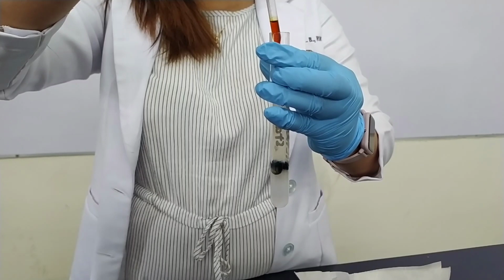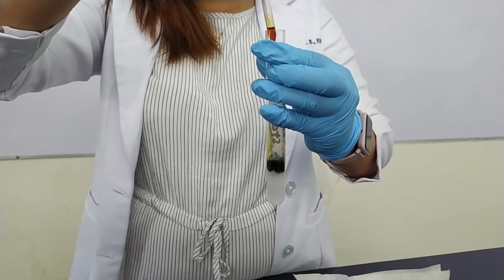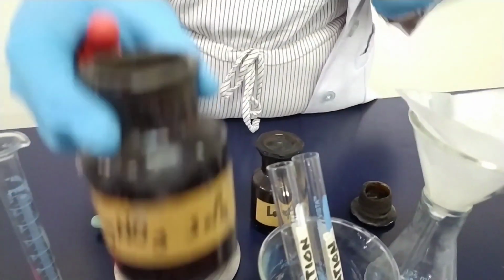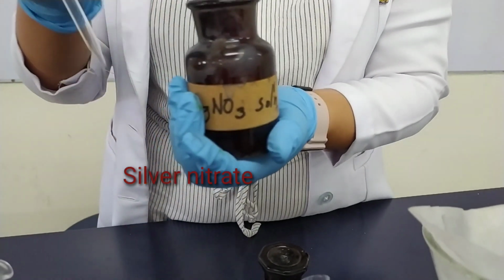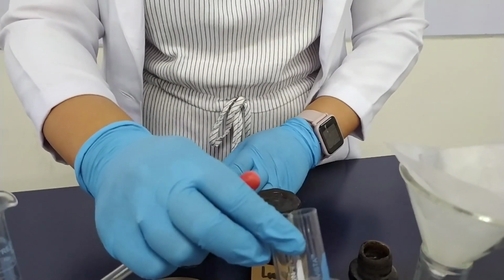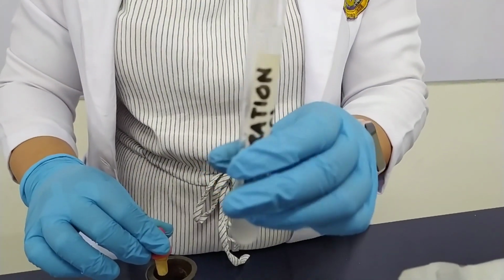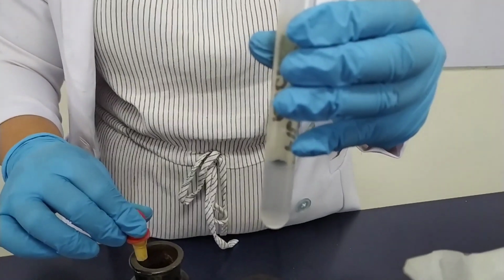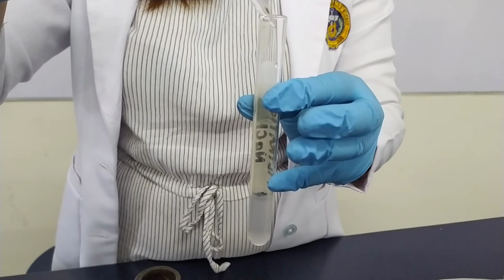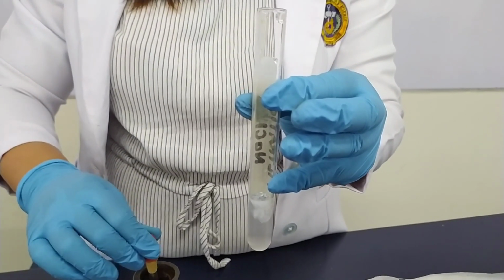Blue-black color indicates the presence of starch. To test for sodium chloride, add a drop of silver nitrate. The formation of a white precipitate indicates the presence of sodium chloride.